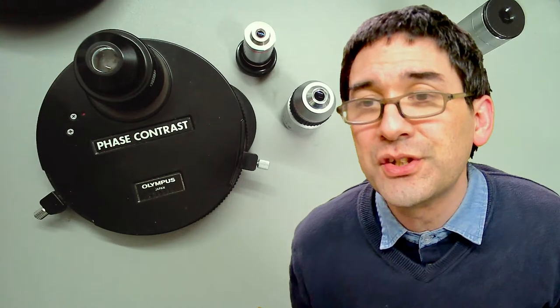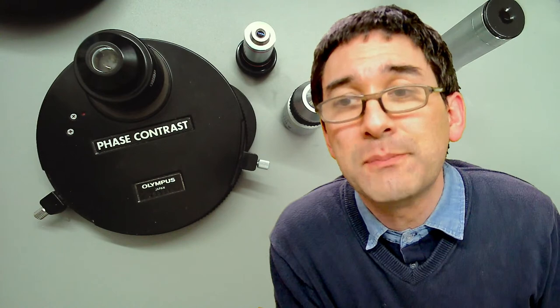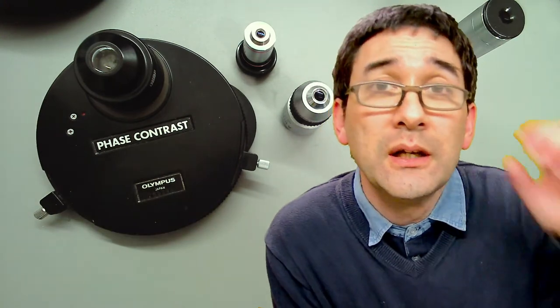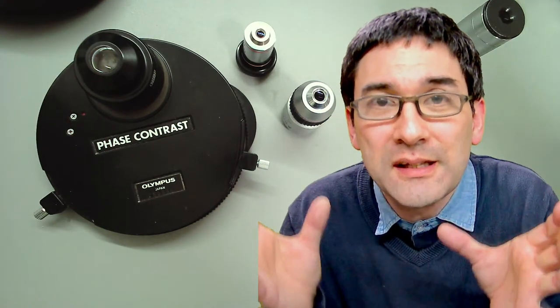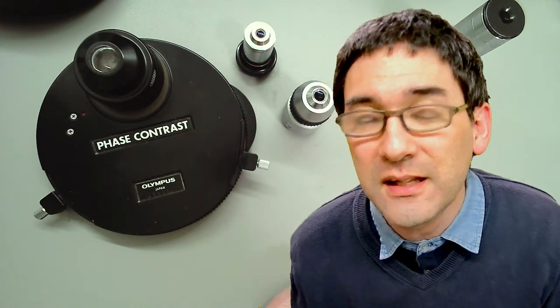Someone asks about the benefits of a dark field condenser vs. a filter. A specific dark field condenser has concave mirrors built inside which redirect the light, giving higher light intensity. You can also achieve higher magnification with it. This is quite a large topic on its own.